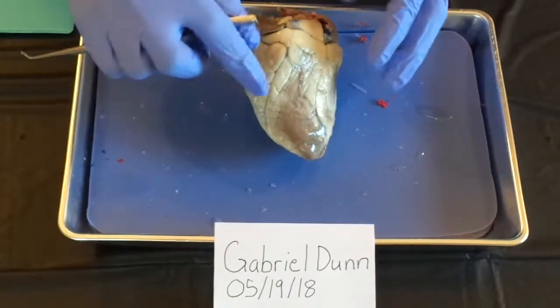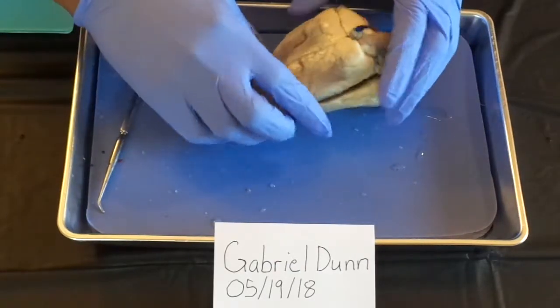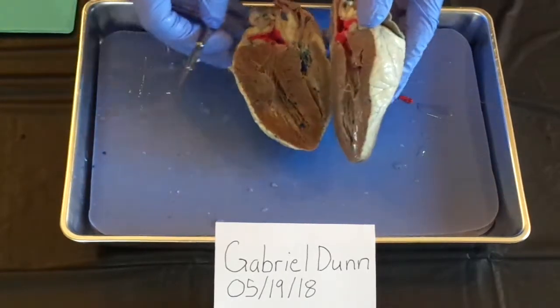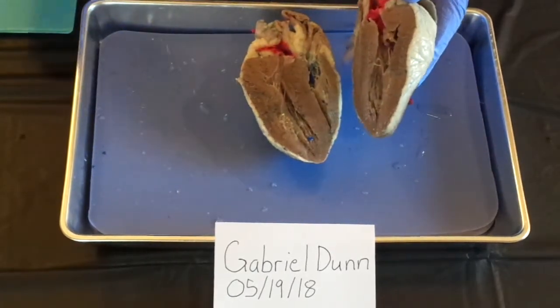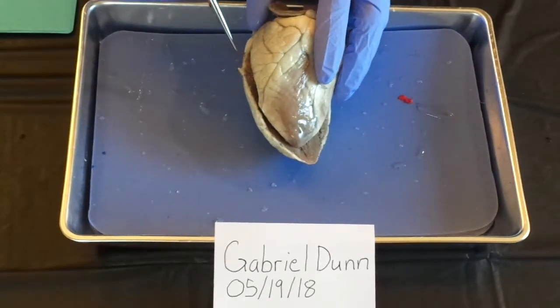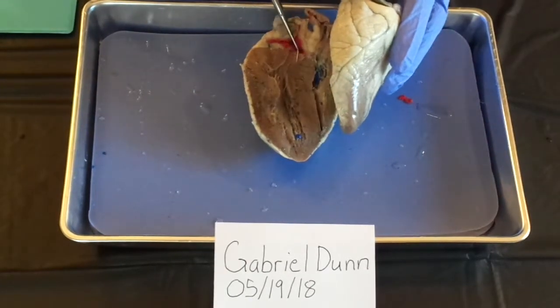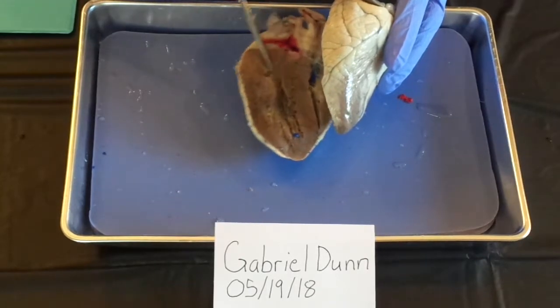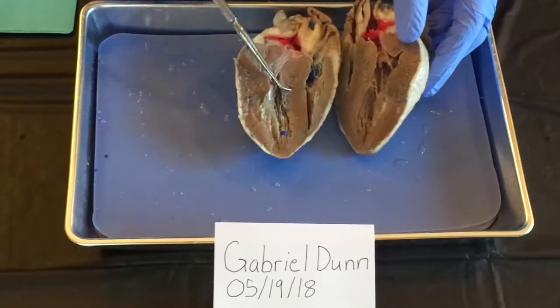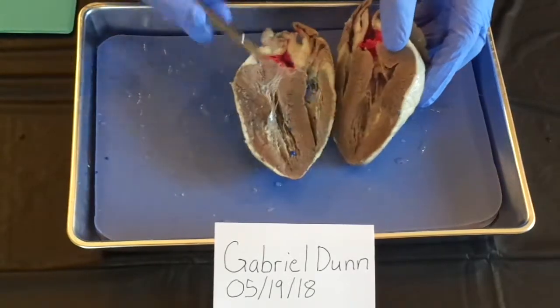So I've already cut open the heart here to expose. Let's go ahead and start with the right side here. Just going to follow along with the flow of blood here. So you get the blood coming in to the right atrium here, and then it flows down here to the right ventricle, and it's expelled towards the lungs through the pulmonary artery to get oxygenated.